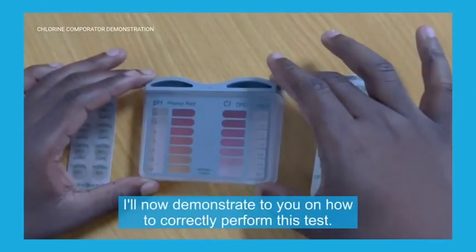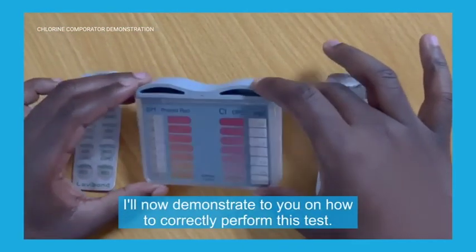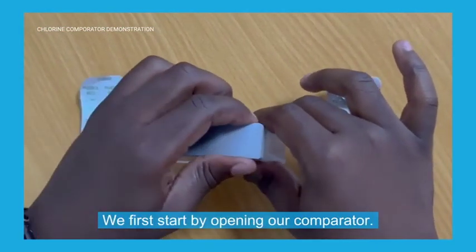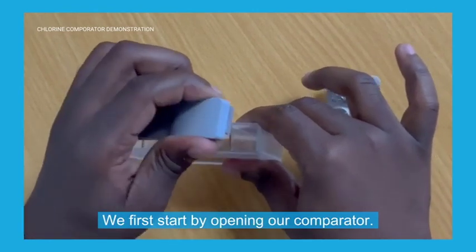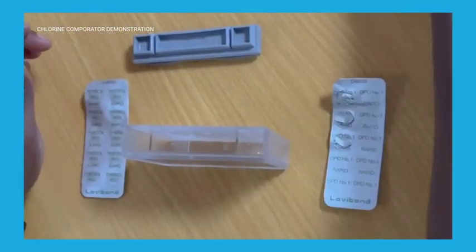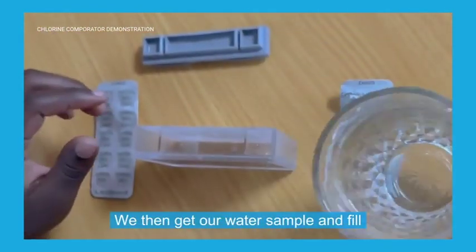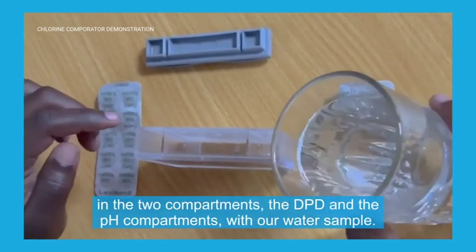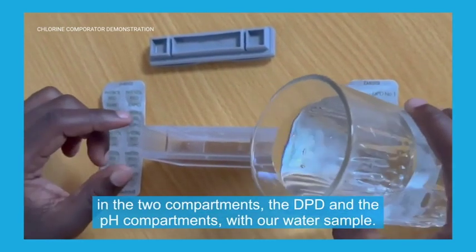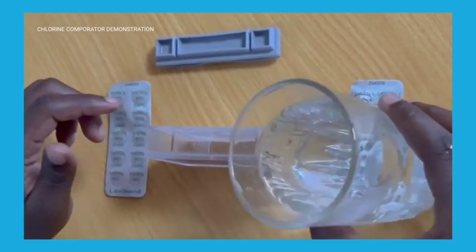I'll now demonstrate how to correctly perform this test. We first start by opening our comparator, then get our water sample and fill in the two compartments — the DPD and the pH compartments — with our water sample.